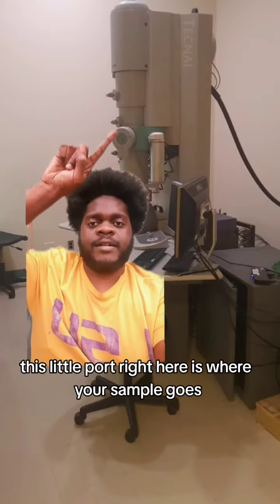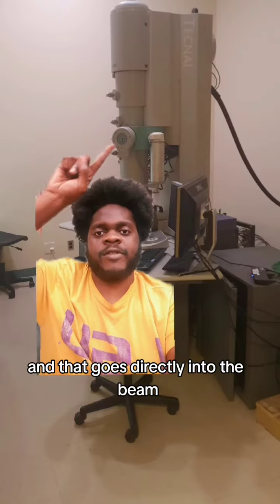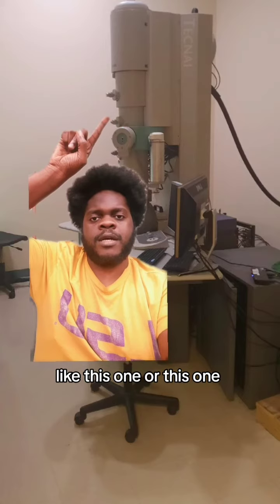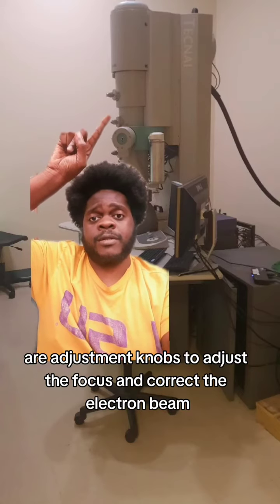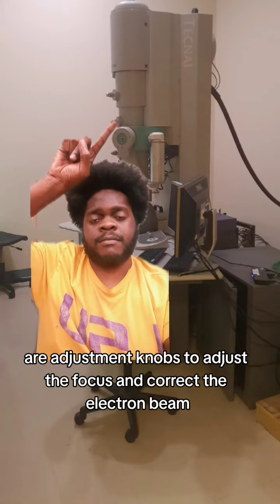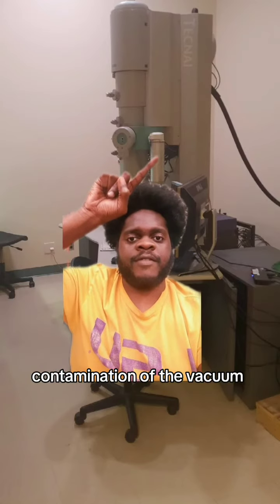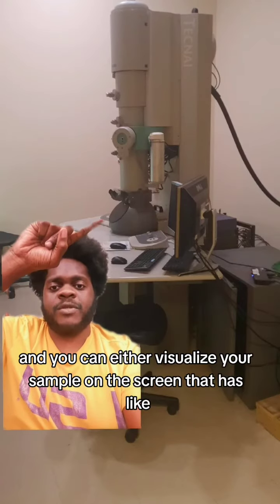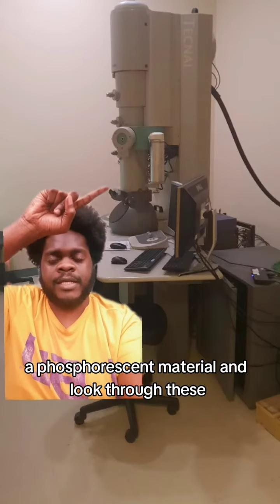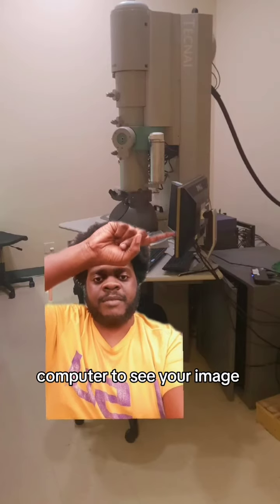This little port right here is where your sample goes, and you insert your sample on a sample arm, and that goes directly into the beam. All of these other knobs, like this one or this one, are adjustment knobs to adjust the focus and correct the electron beam. And this is a cold trap to prevent contamination of the vacuum. And you can either visualize your sample on this screen that has like a phosphorescent material and look through these eyepieces, or you can look on the computer to see your image.